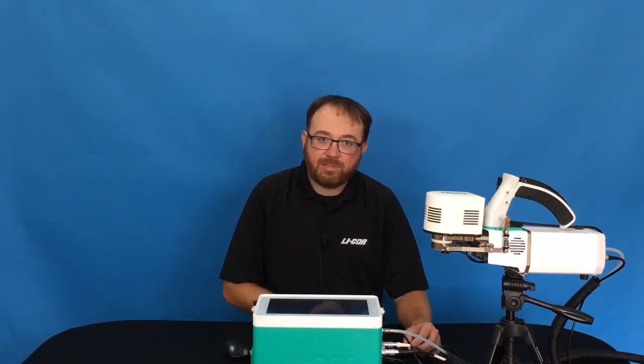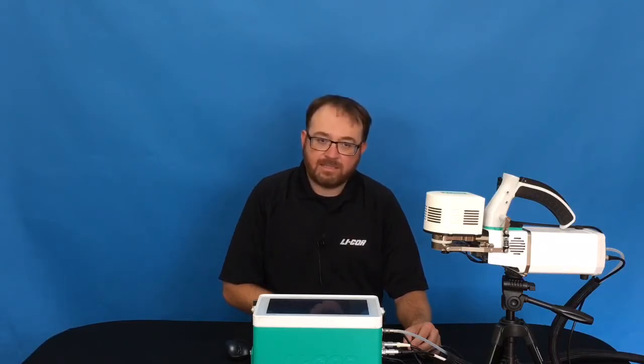Hi, I'm Aaron Sadoff, Senior Application Scientist at LI-COR Biosciences. Today we will be talking about range matching in the LI-6800. We will cover what range matching is, why you would like to use it, and how it is done.